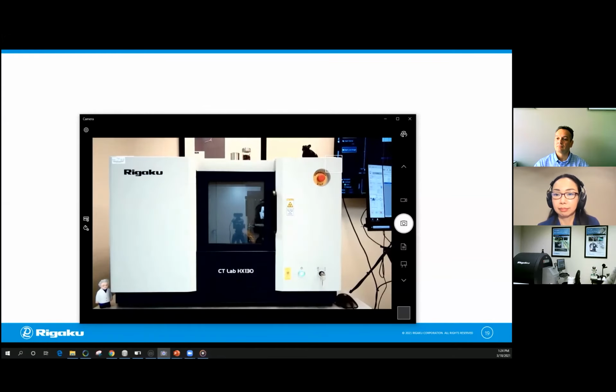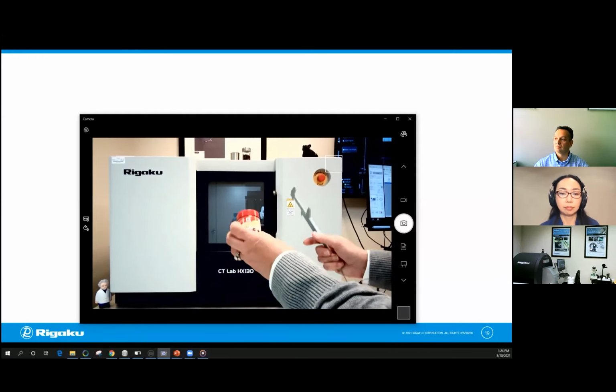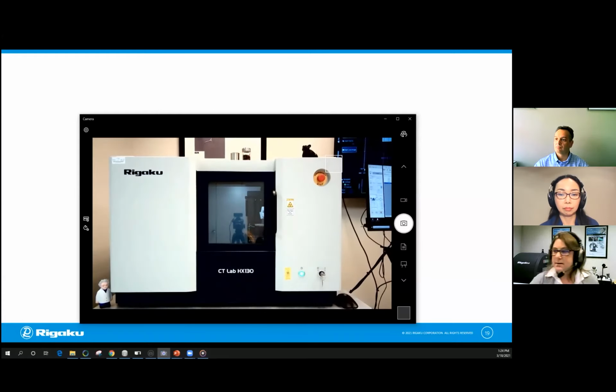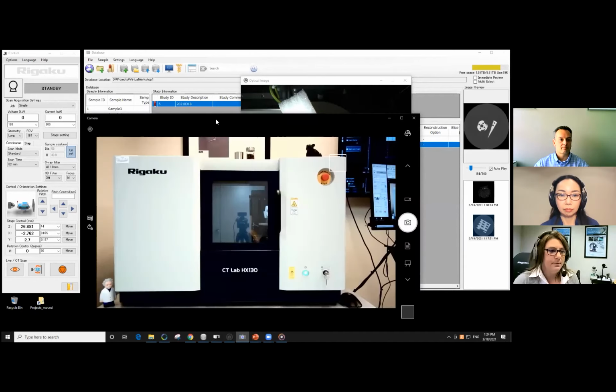Okay, so that's great. Now these, if I just measure this guy, it's smaller than the other one, right? Not as tall, and we're not all the way full of cloves, so we don't need to measure the whole thing. So what I'm going to do is put the share back to the other side so you can see the instrument. And I'll just put this back here. We're going to put the sample in.